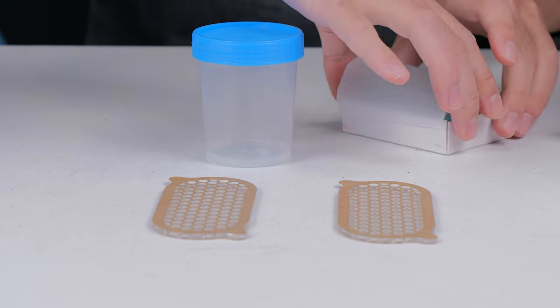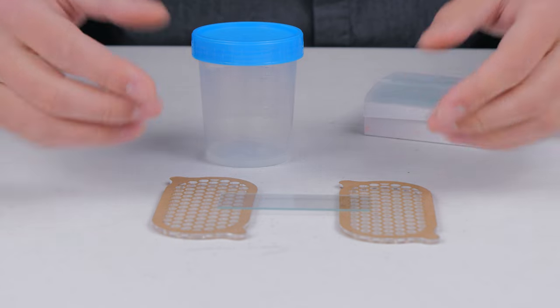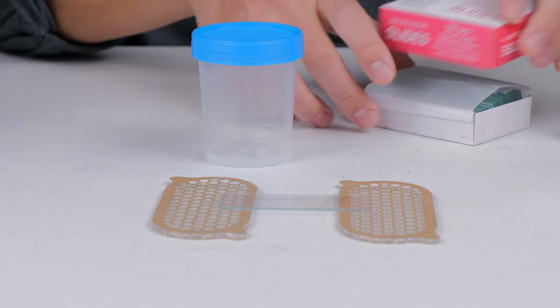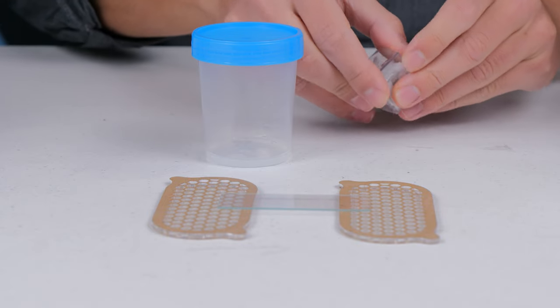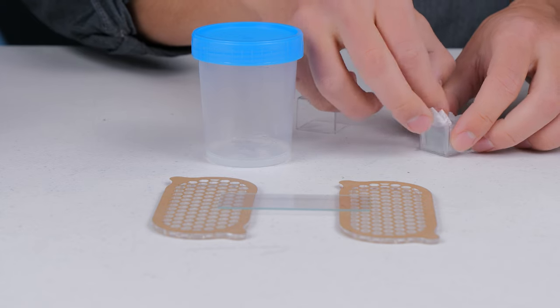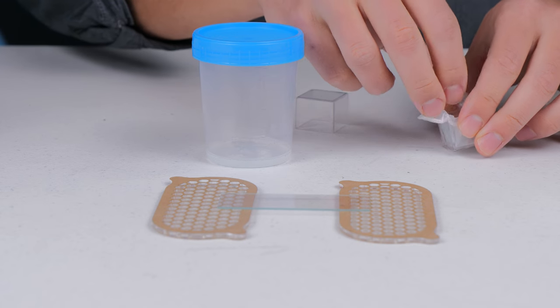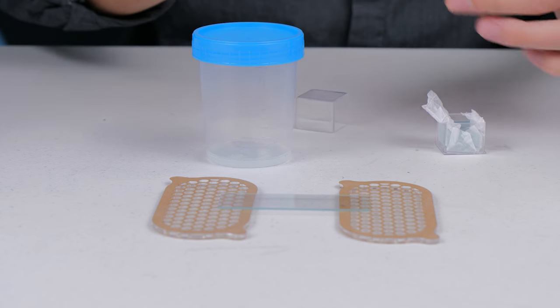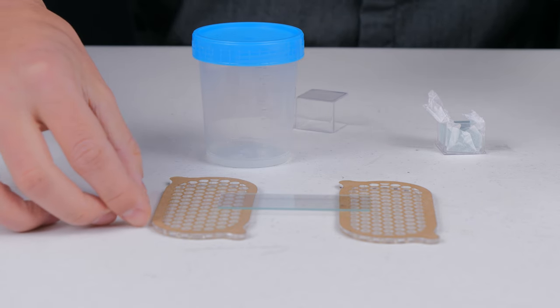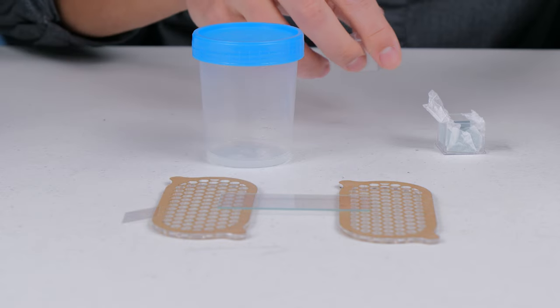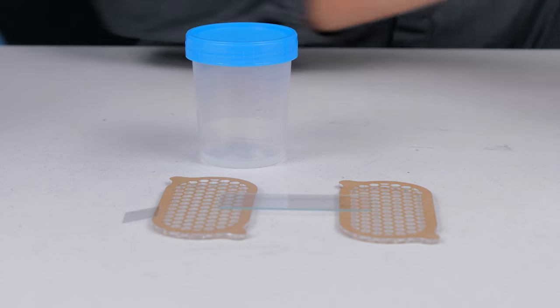Now we're going to transfer some of our sample onto a microscope slide, just taking out a regular microscope slide. I like to have some kind of a standoff or something to hold the microscope slide up above the table so it doesn't get any kind of dust particles underneath of it on the underside. I'm going to have our cover slips out and ready. Typically what I'll tend to do, make sure never to touch the optical faces of these components. I like to take it out, and then sometimes you'll accidentally grab like five cover slips, that's okay because it comes with a ton of them. I also like to just preemptively set it down on something again, making sure that you don't set it down directly flat on the table because then dust particles are going to get all over it.